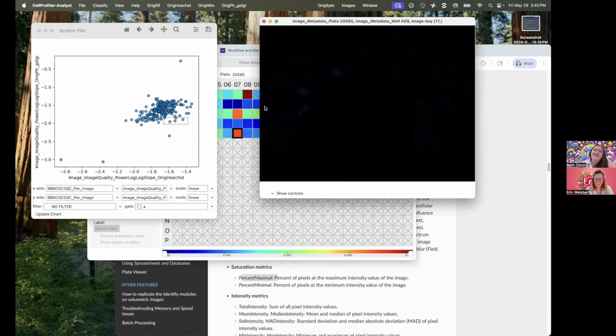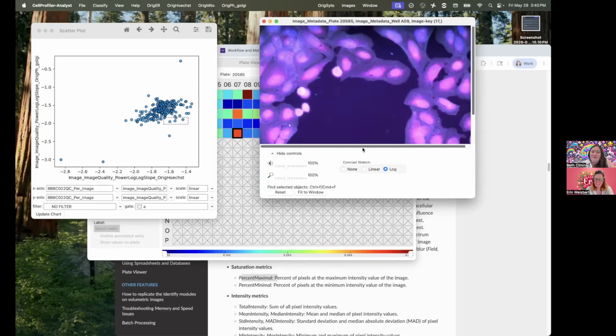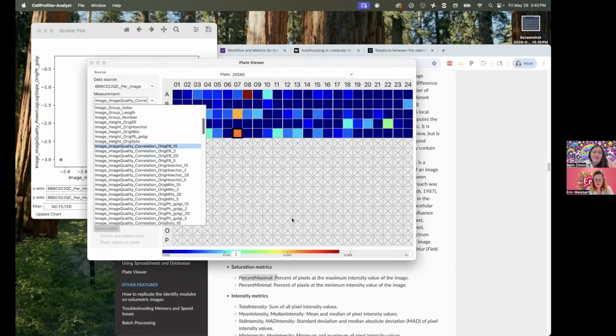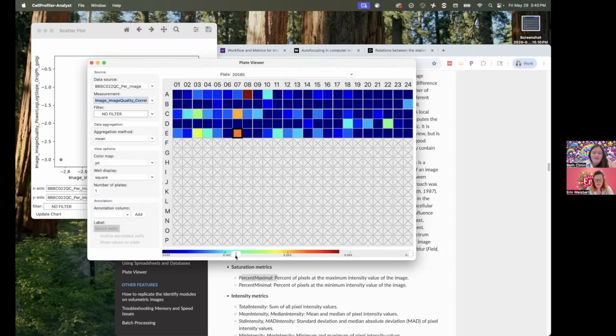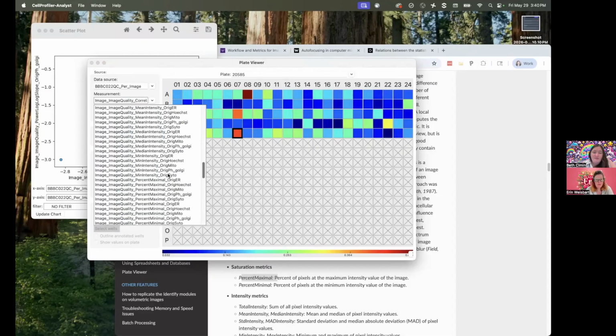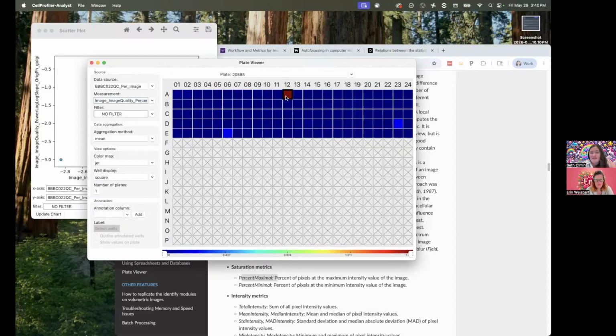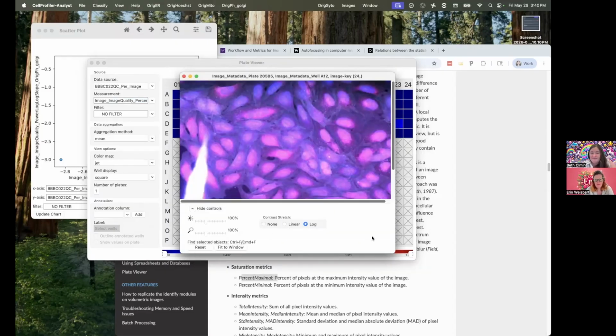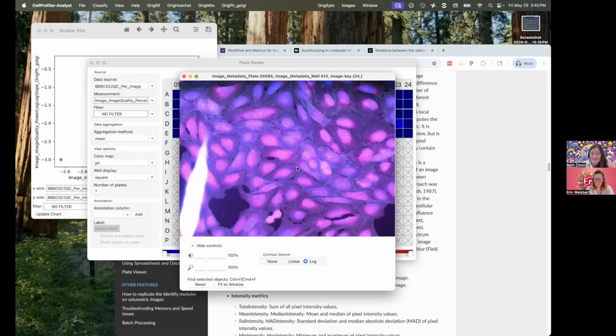That's not why we spend all of this time lovingly doing all these experiments only to throw them away. So I just want to do one more here. Oh, I didn't mean to move that. Which is to show the one that Erin mentioned, which is percent maximal, because that we can definitely use to find things like debris. There we go. That's a big old piece of debris. That should not be there.